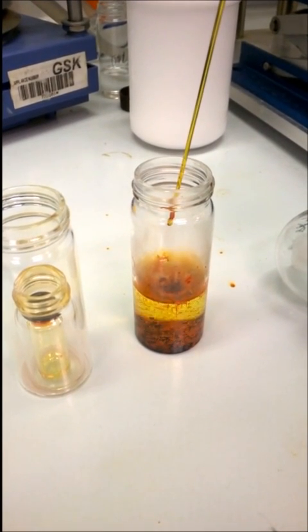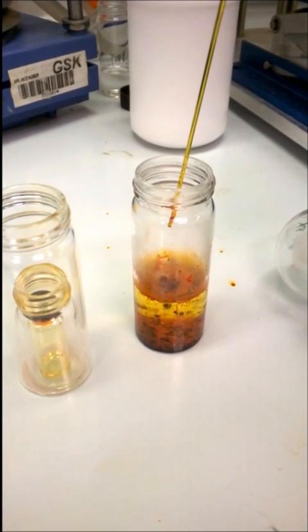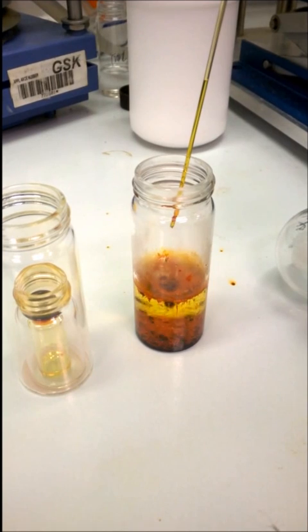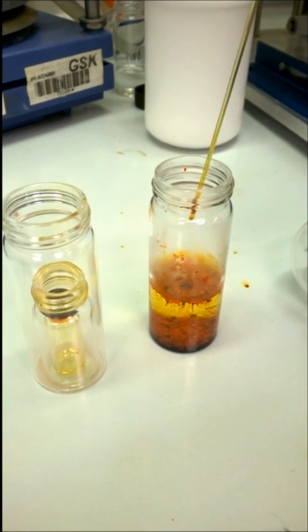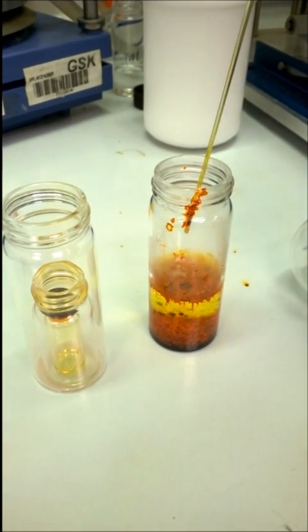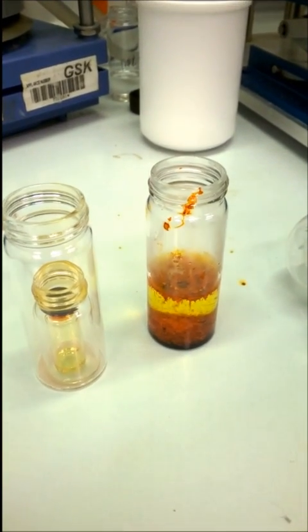It's kind of dropping out here and there around the bench, but I'll wipe that up in a bit. Nice little jumping beans there. Cool. That's the worst done there.